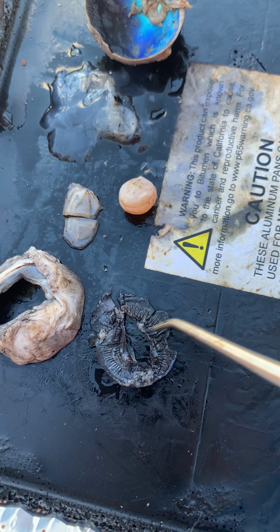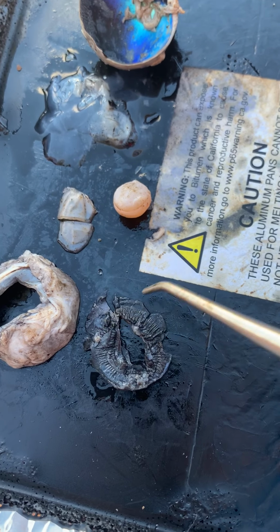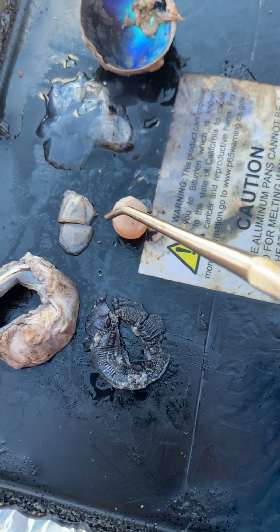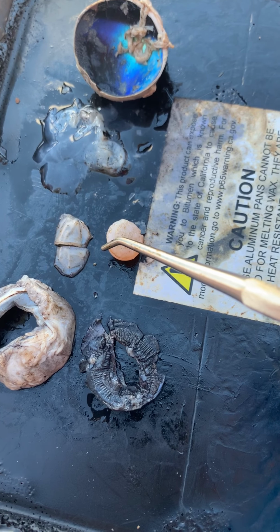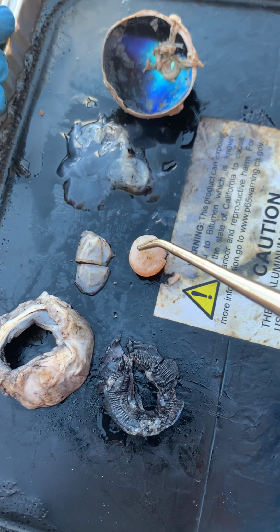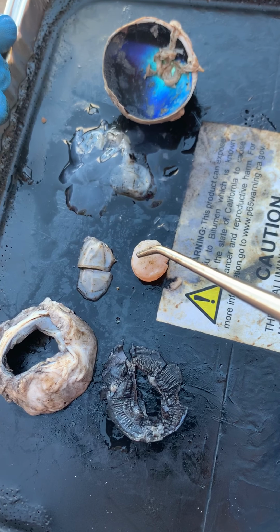The zonula ciliaris are fibrous strands that suspend the lens and control lens accommodation. The lens then allows for accommodation to occur, and that gives the ability for your eyes to adjust from seeing things from far away to seeing things close up, and vice versa. But as people age, this lens becomes more stiff, and that makes them have the need for glasses.